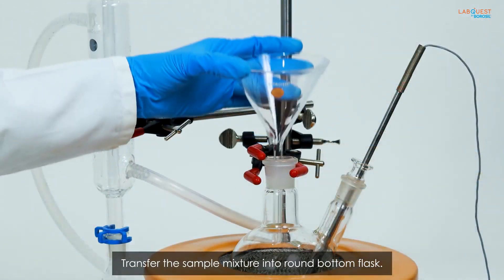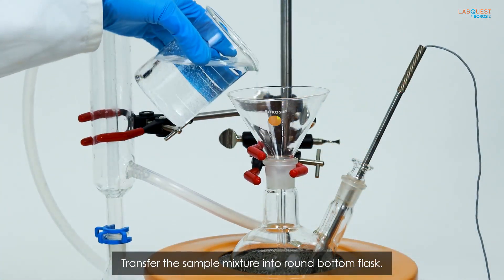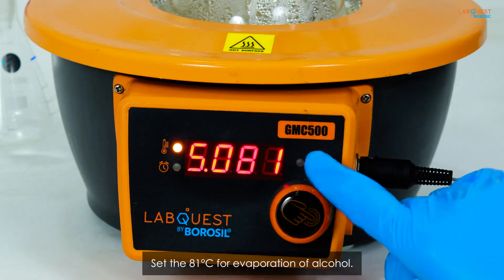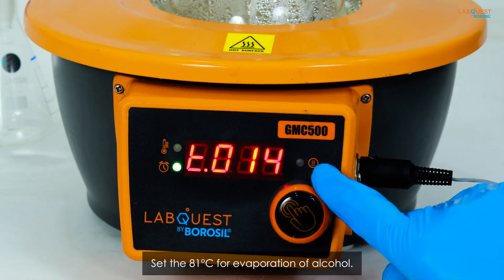Transfer the sample mixture into round bottom flask. Set the temperature to 81 degrees Celsius for evaporation of alcohol.